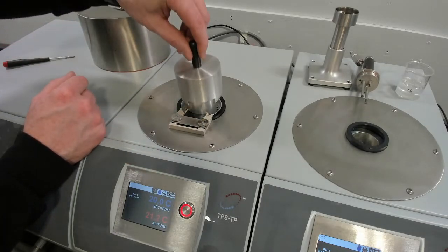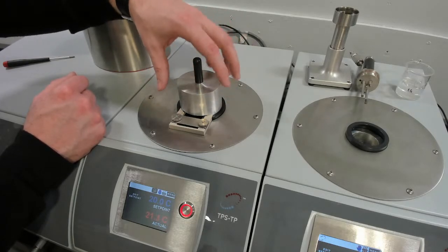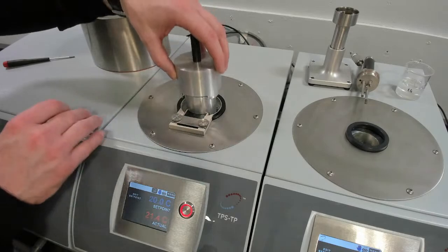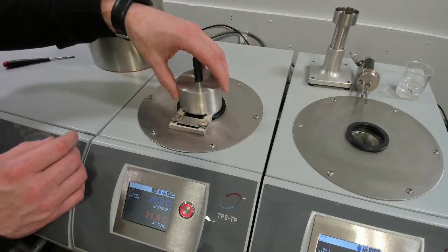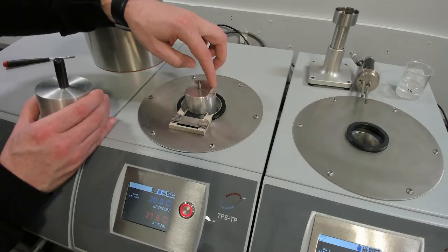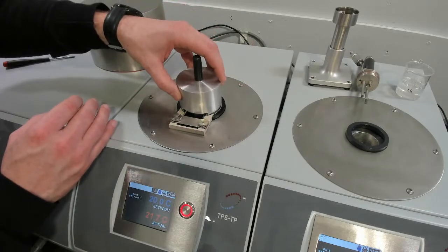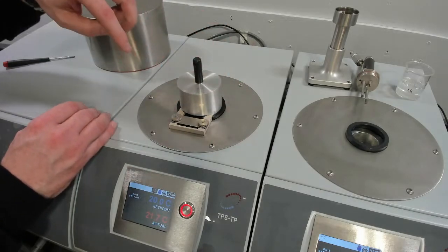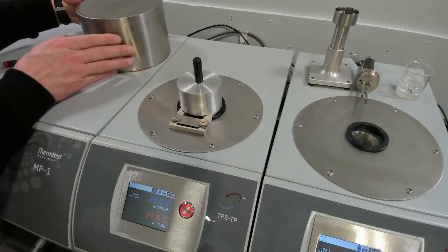This closes out the cooling. So the way the temperature platform works for the TPS is you have cooling on the outside. So this closes the cooling part of the temperature platform. And this portion around the sample is the heating. So you have these opposing temperatures that work really well in partnership to give you precise control of temperature and fast temperature stability. And this is the last step.